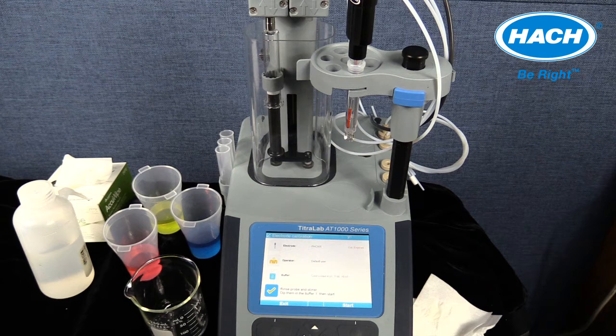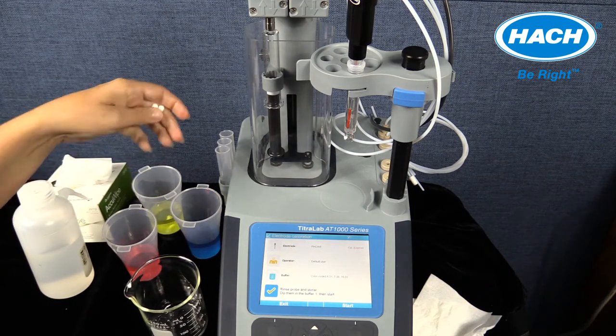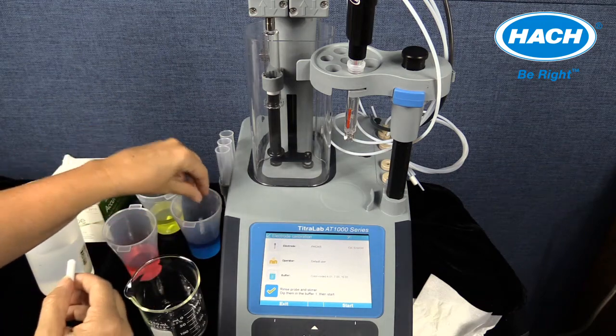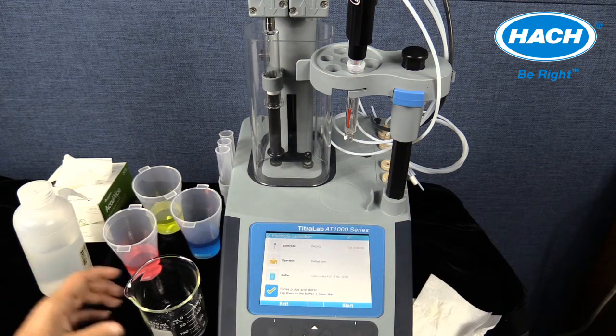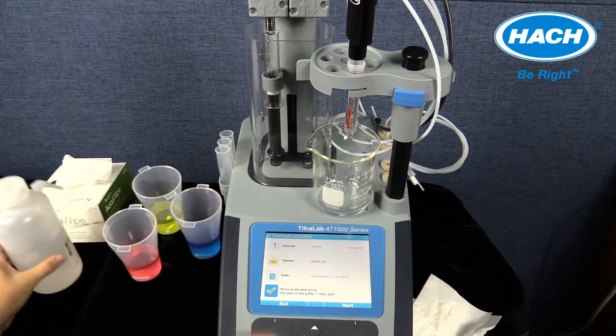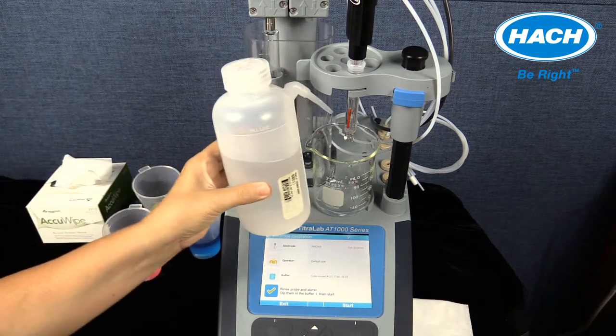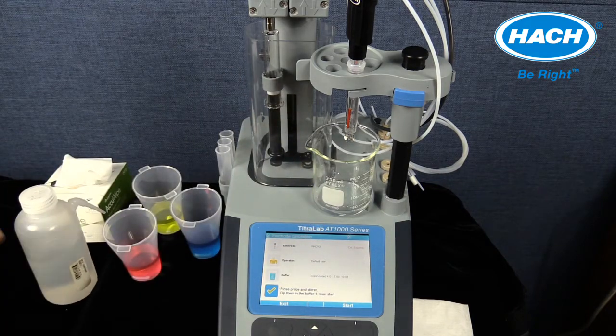The titrator must now be prepared. Pour a small amount of each buffer solution that will calibrate the pH electrode into 3 separate sample beakers. Add a stir bar to each beaker. Rinse the electrode with deionized water using a wash bottle and waste container. Blot the electrode dry with a clean wipe. Confirm that the filling hole is open during the calibration steps and when measuring samples.